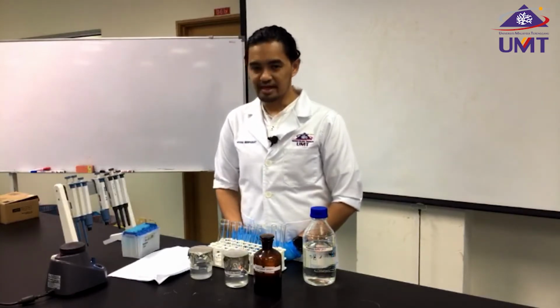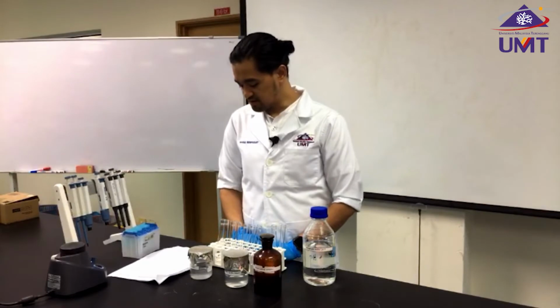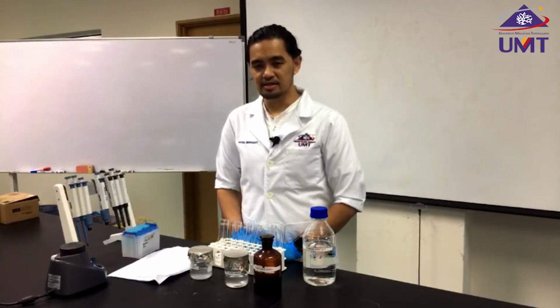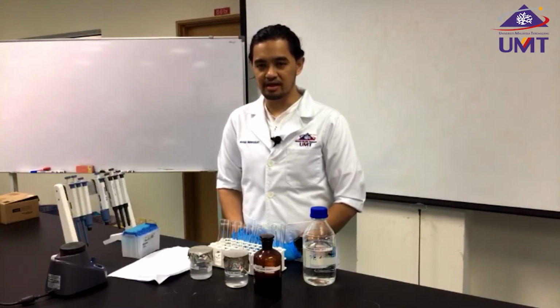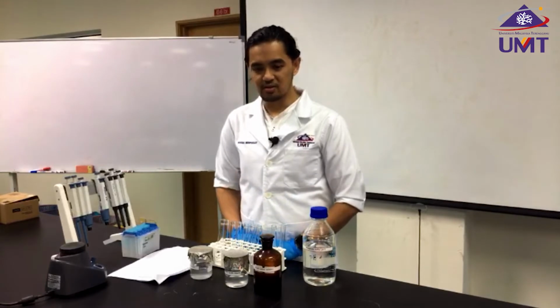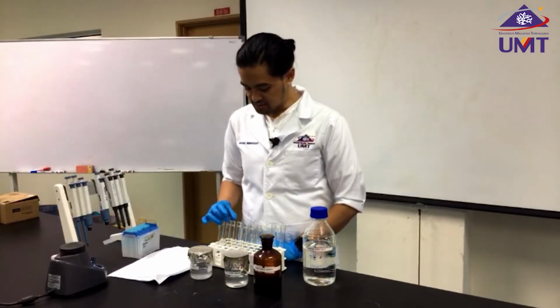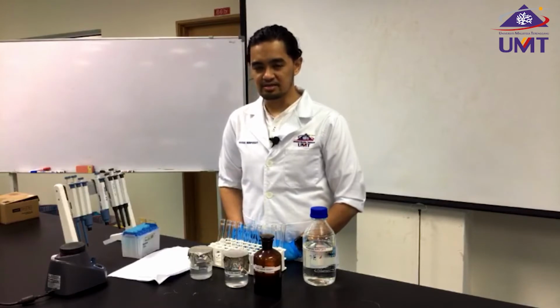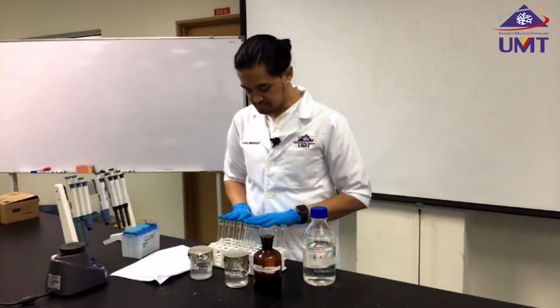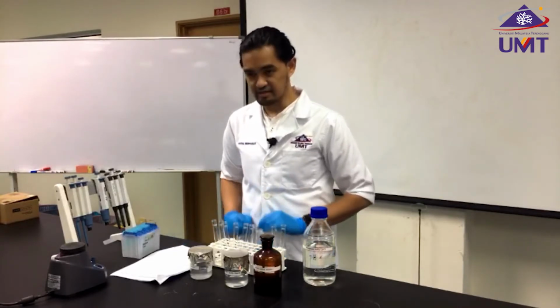Another tool that is going to be involved, which will not be shown in this lab session, is the UV spectrophotometer. However, we will give you a mock result, which you need to plot, and those results are based on the UV spectrophotometer reading. In this experiment, I'm going to show how important it is to use the standard curve to determine the enzyme activity. So for the first experiment, I'm going to construct the standard curve.